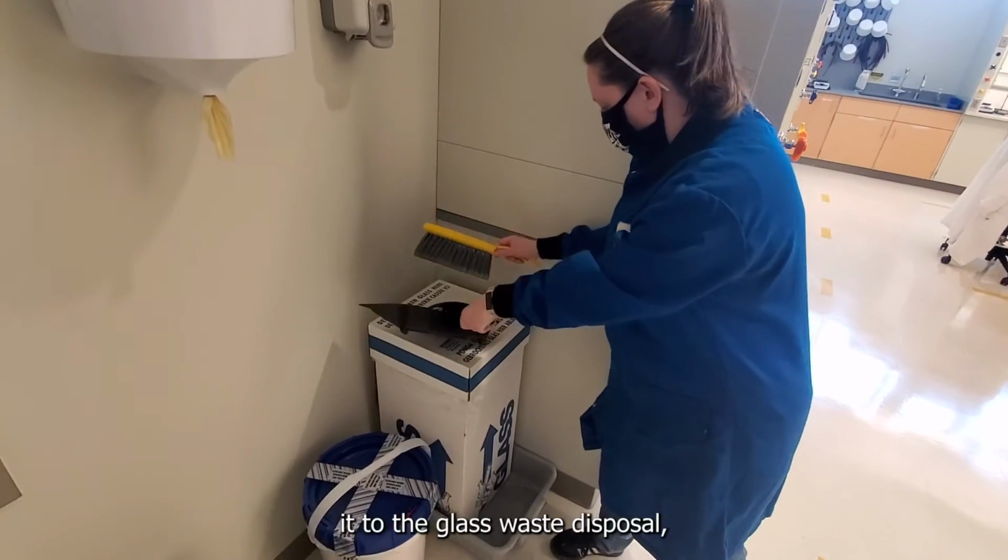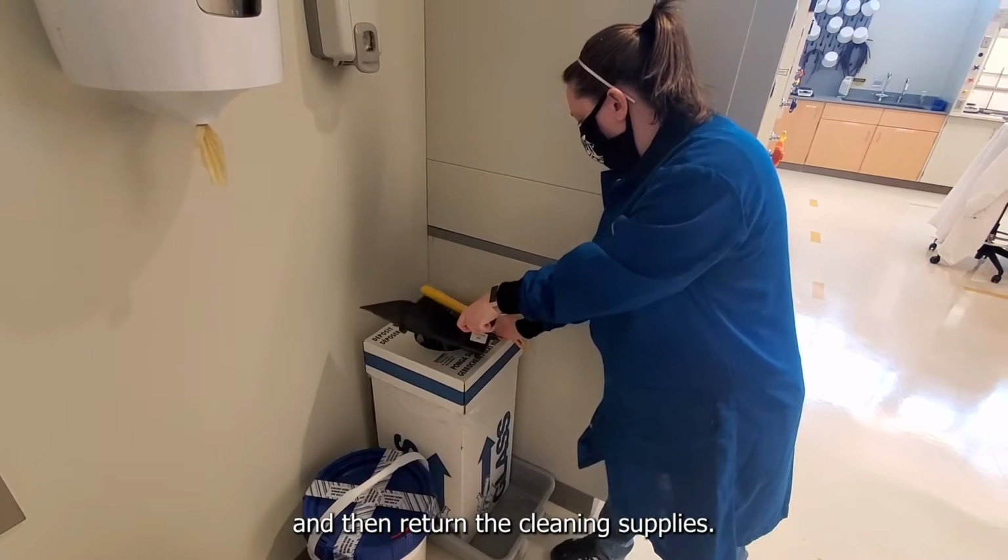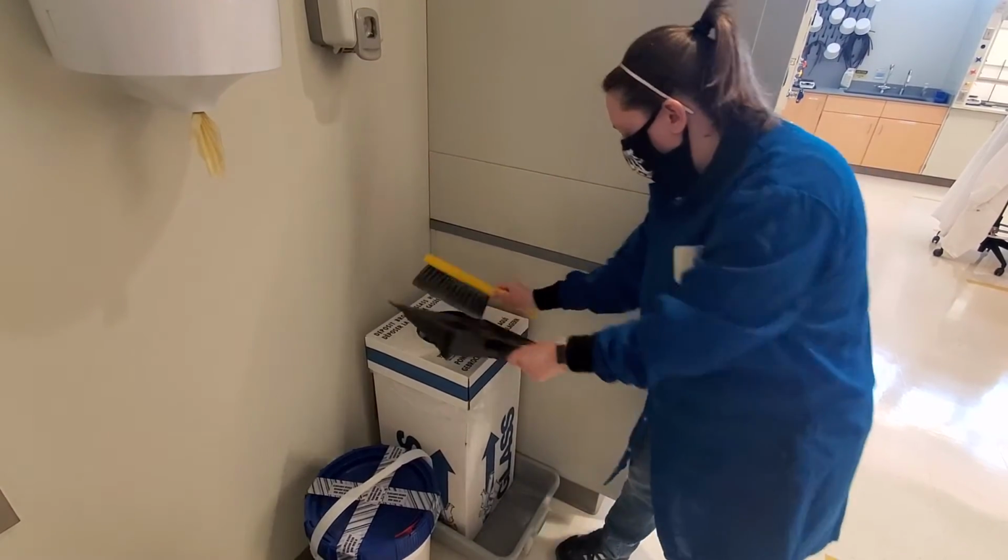Here, Tara brings it to the glass waste disposal, where she will empty it out and then return the cleaning supplies.